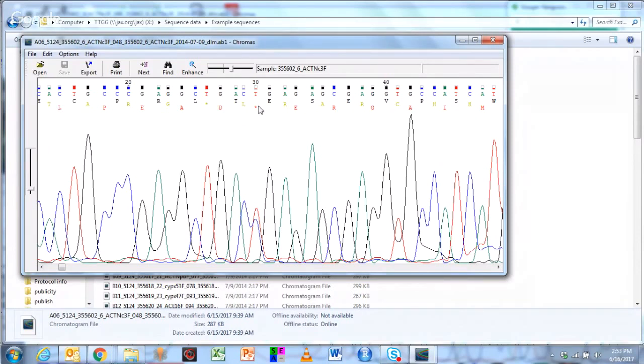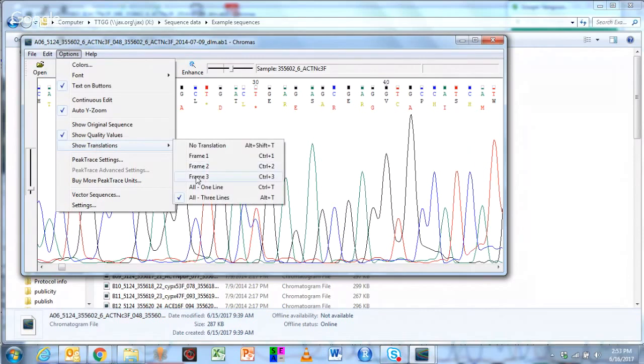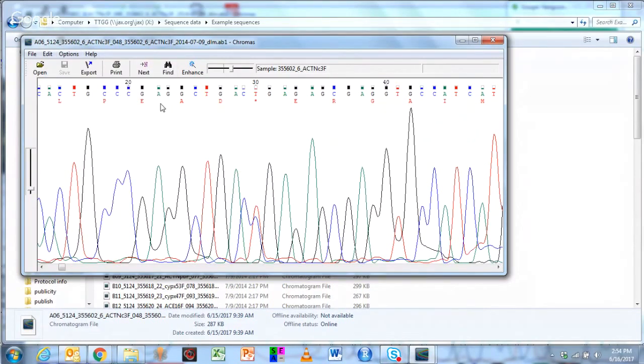I happen to know that this is in frame 3, so I'm going to go back and show the translation in frame 3 only. And you can see here that you've got the normal amino acid sequence of the gene ACTN3 (actinin 3) with a stop here. If this were a C, this would be CGA, which would be arginine, hence the name R577X, or arginine at position 577 changed to a stop codon. So that's the change here.